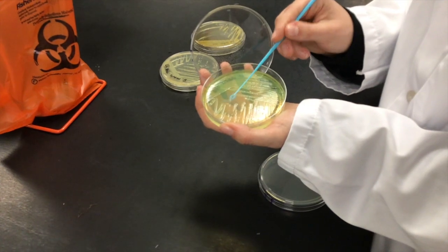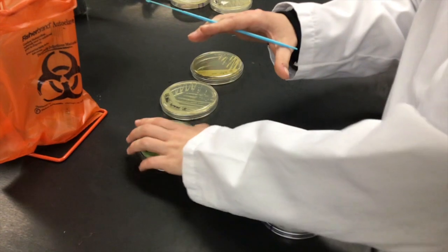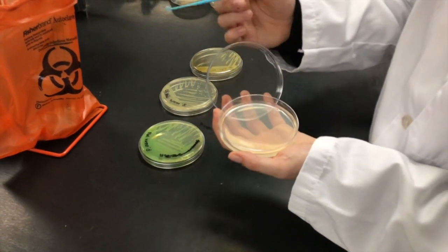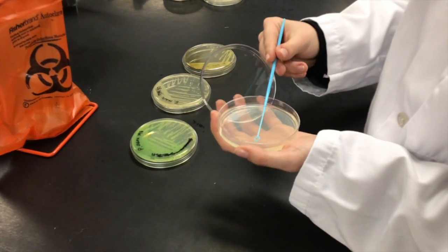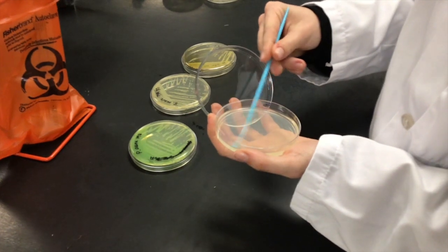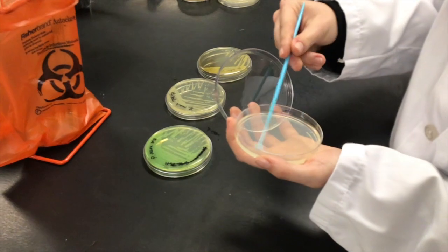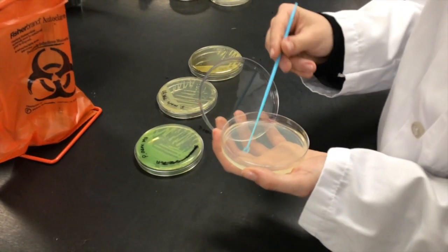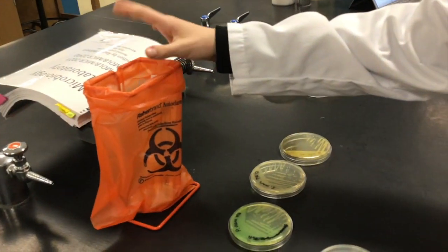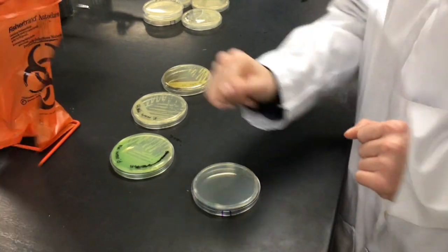And with the sterile loop, Megan's just going to pick up a small bit of a colony on her loop. Keep in mind that these loops are plastic and sterile, but they're only sterile for single use. When she's ready to inoculate, she's going to take her loop and drag it across her agar plate in the pattern that she wants her bacteria to grow in. When she's done, she's going to throw that sterile loop into the biohazard bin before she picks up her next loop.